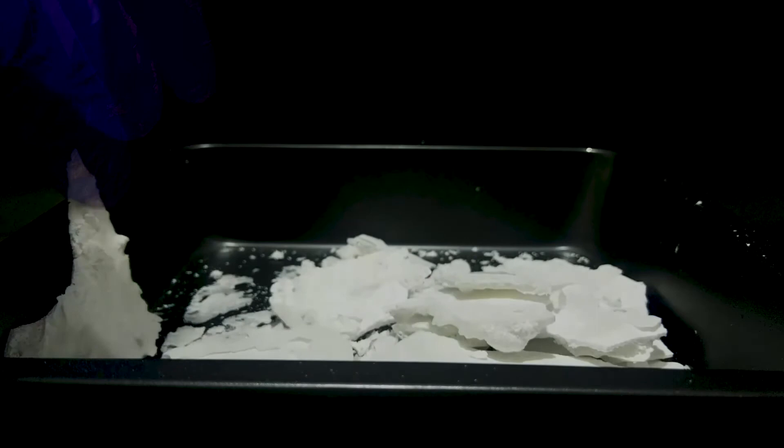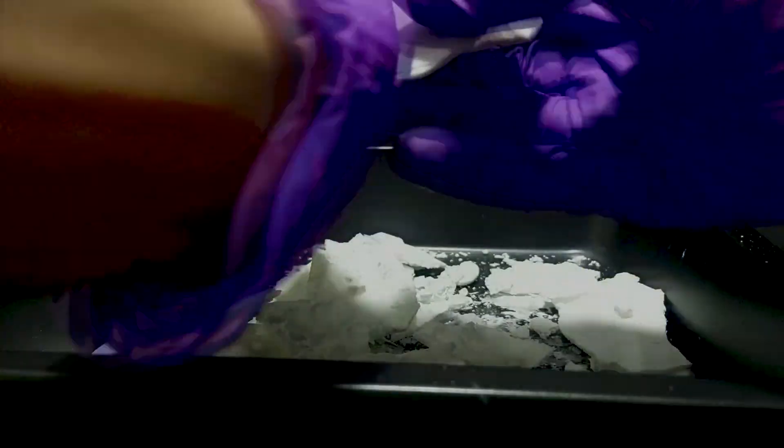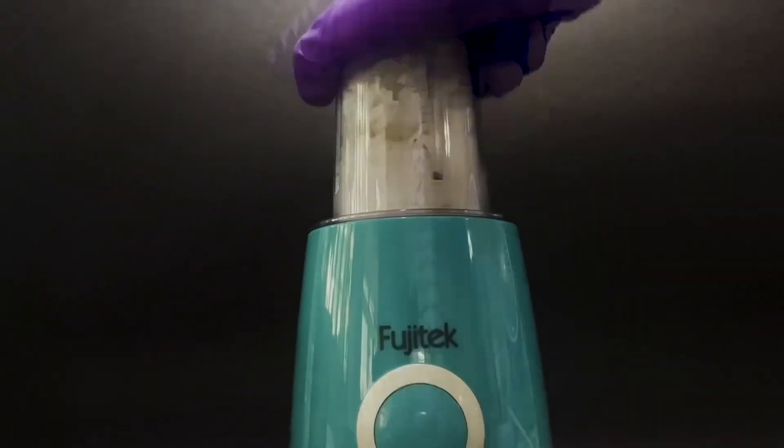Since the crystals will dissolve in their own water, it might form a hard chunk block of anhydrous sodium citrate like I did. Hence, I put it in a blender to powder it.